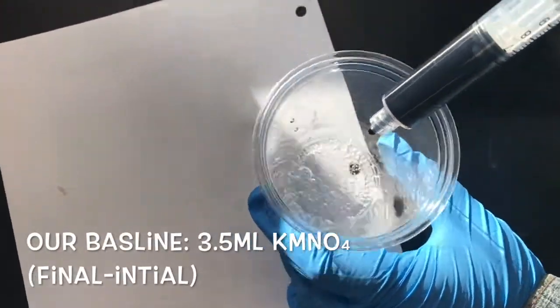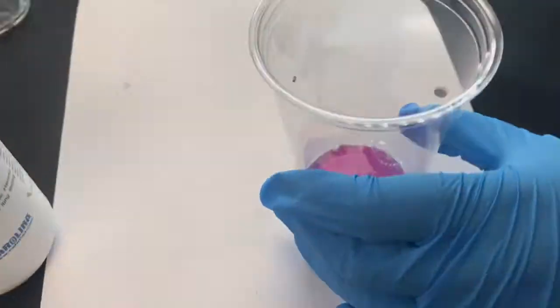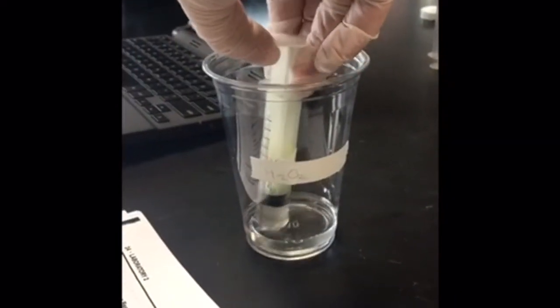After about 75 drops, the pinkish color was obtained, showing that the titration of our baseline was complete. For Part C, we wanted to determine the rate of the spontaneous conversion of hydrogen peroxide to water and oxygen gas in an uncatalyzed reaction. We put some hydrogen peroxide in a beaker and stored it overnight.